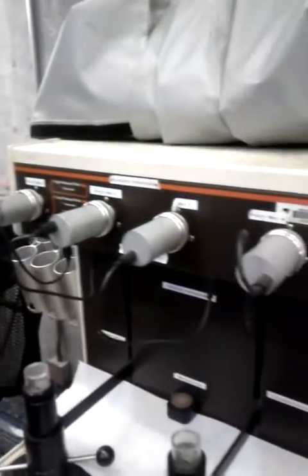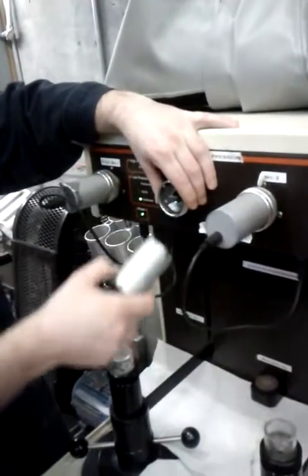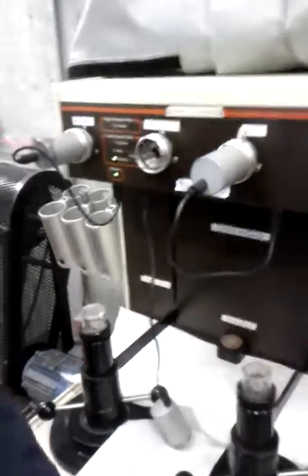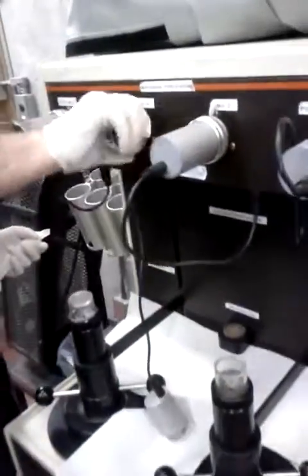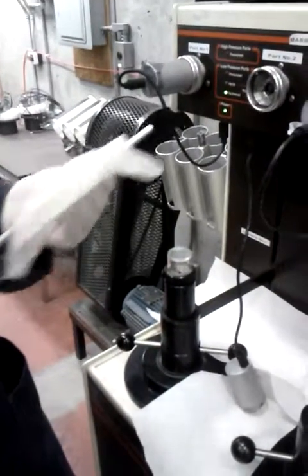So what we can do, we have to open this thing. We have to remove this cover. Just turn it counterclockwise, I think it's the word. Here there is a rod to remove. We have to remove the rod. There could be some mercury on the rod, so turn it, remove it, and because it can have some mercury, maybe there is none. But just like this, okay.